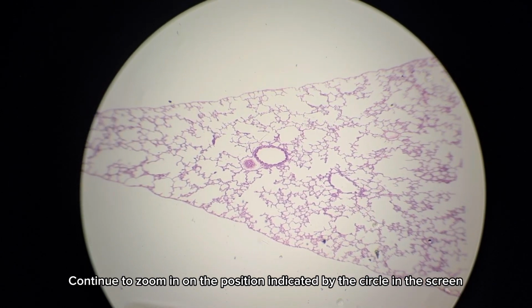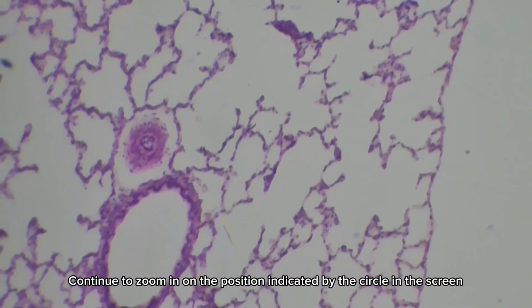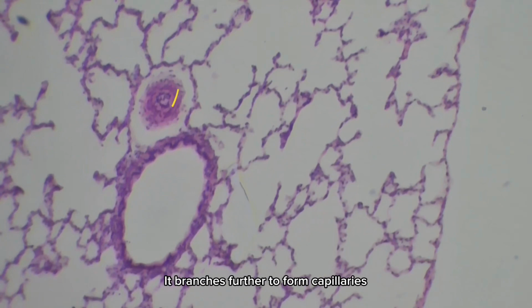Continue to zoom in on the position indicated by the circle on the screen. This is the pulmonary artery. It branches further to form capillaries. These are the little tubes located between the alveoli.